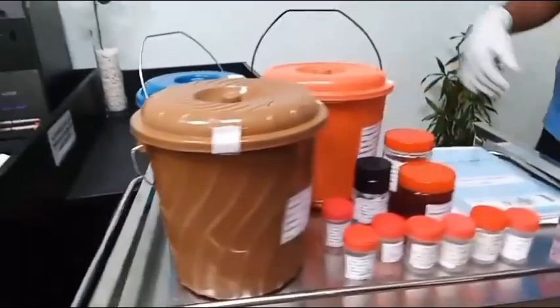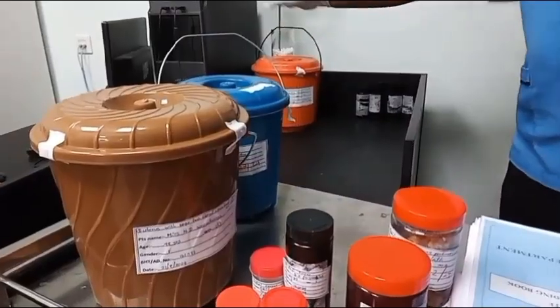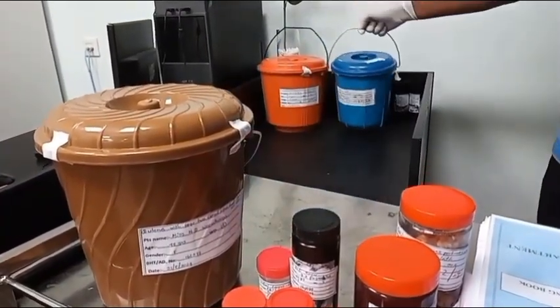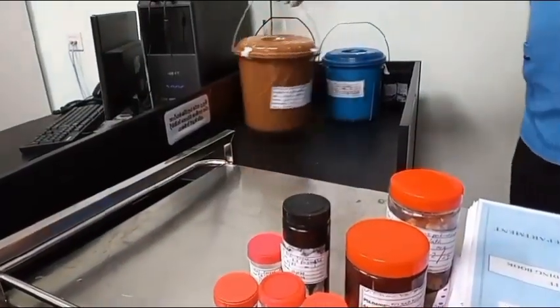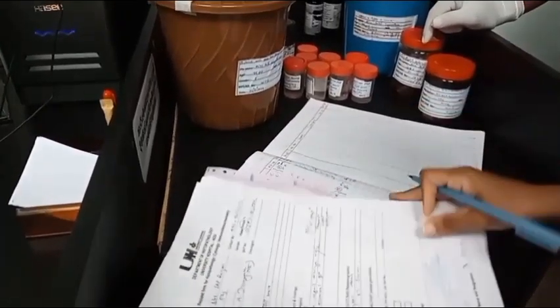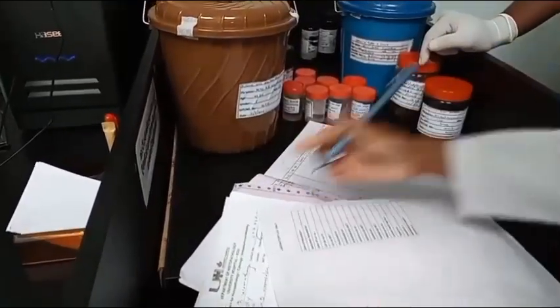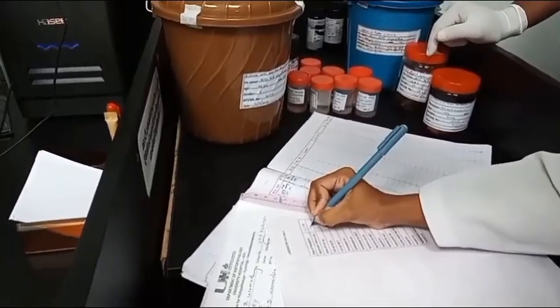Specimen reception. The Histopathology Laboratory receives both histology and cytology samples. These specimens are received and accessioned at a designated specimen reception counter. Specimen accessioning involves receiving specimens, sorting, allocating a laboratory registration number, and documenting in the specimen reception record book or database. Each specimen should be accompanied by a request form.